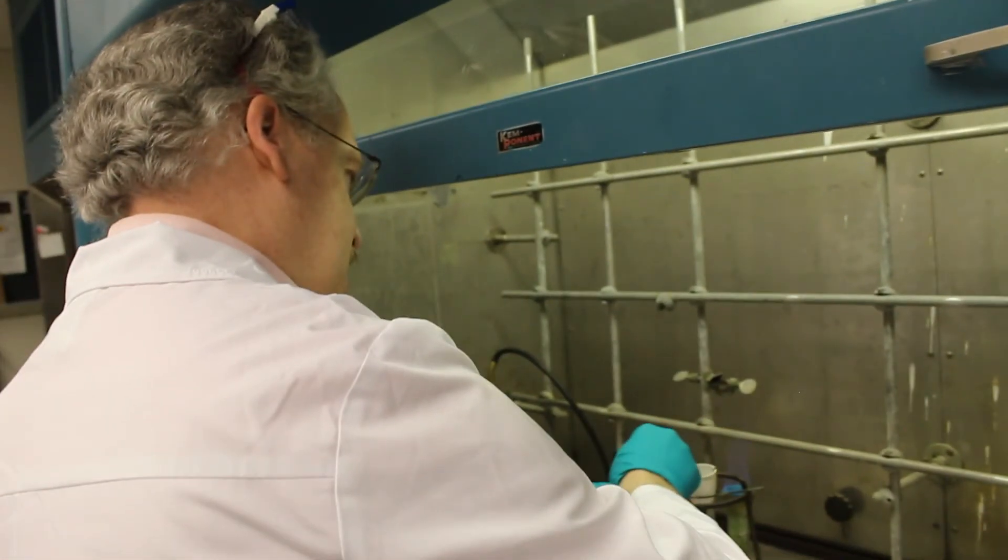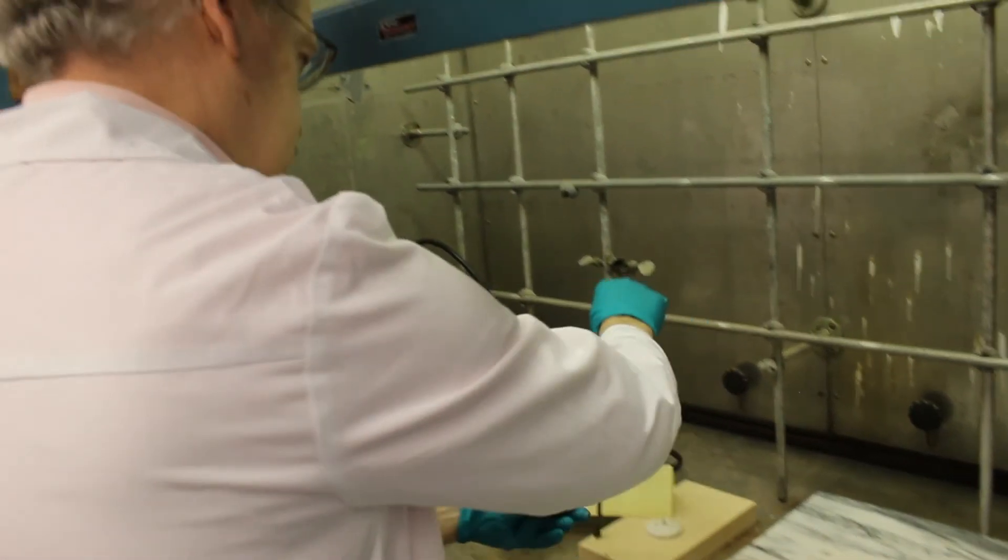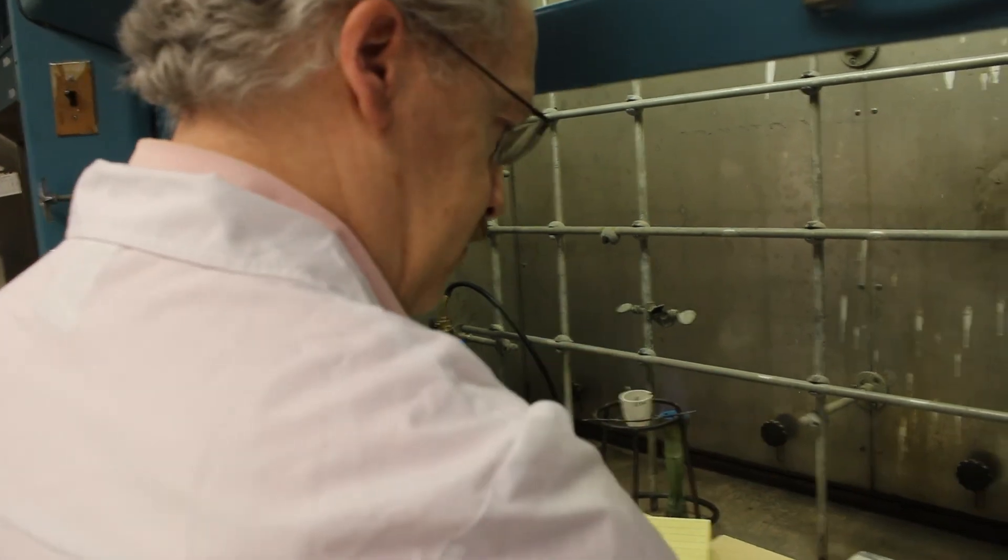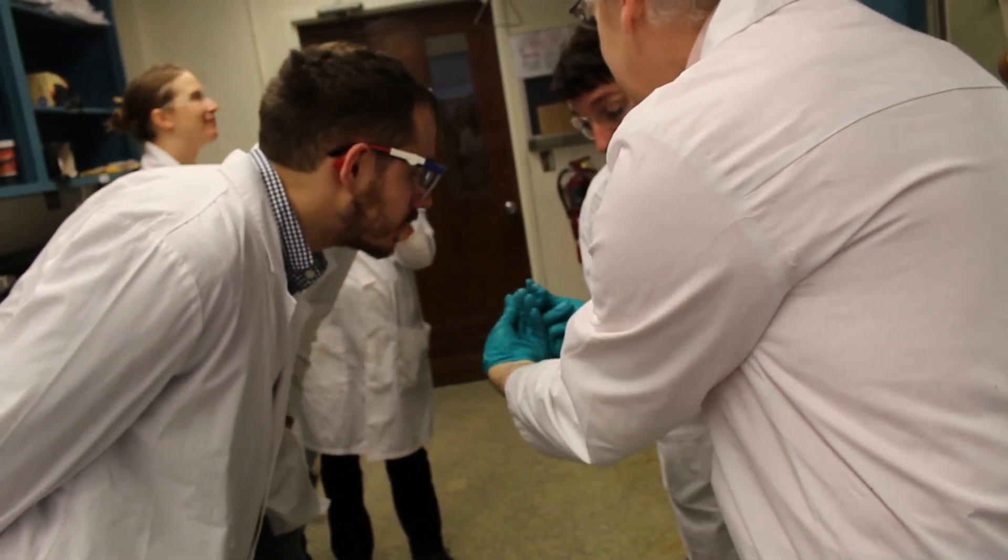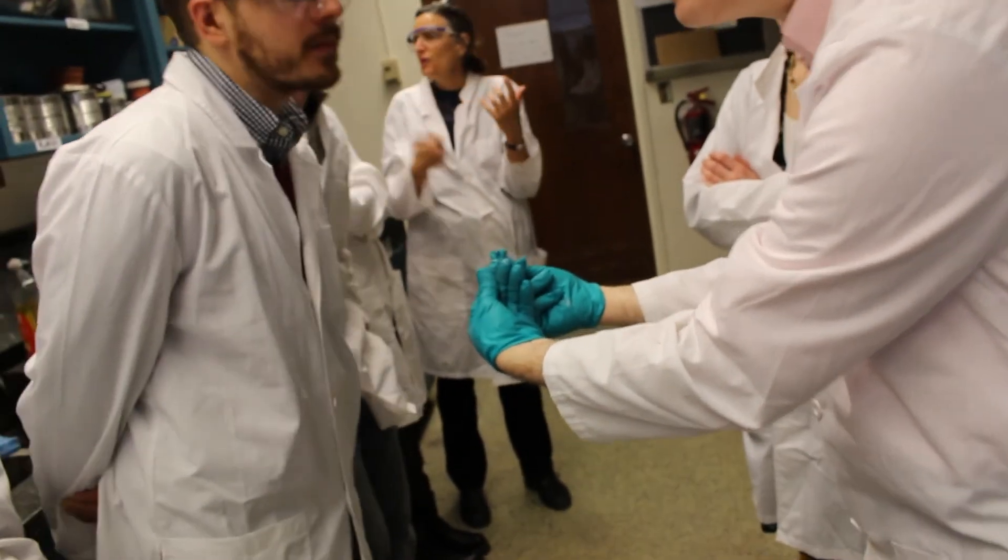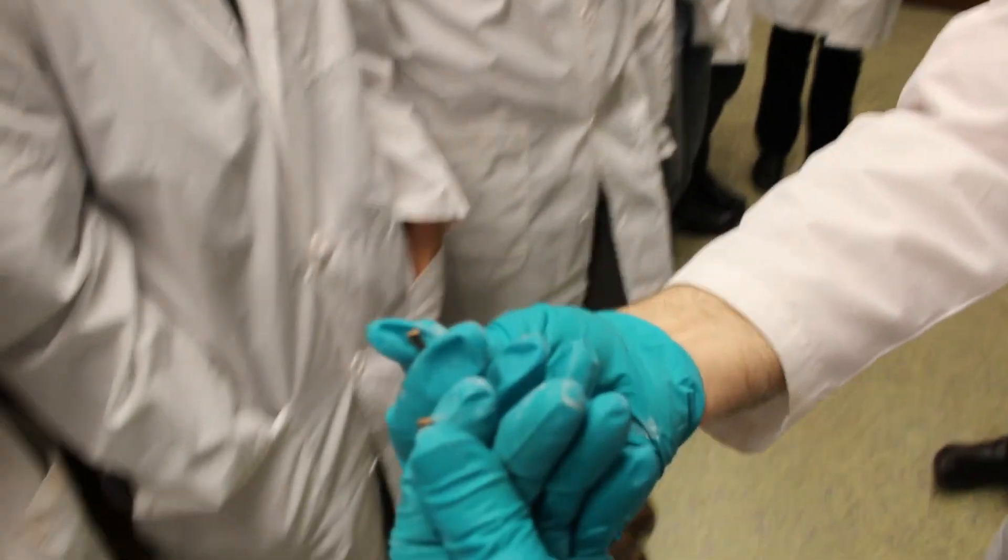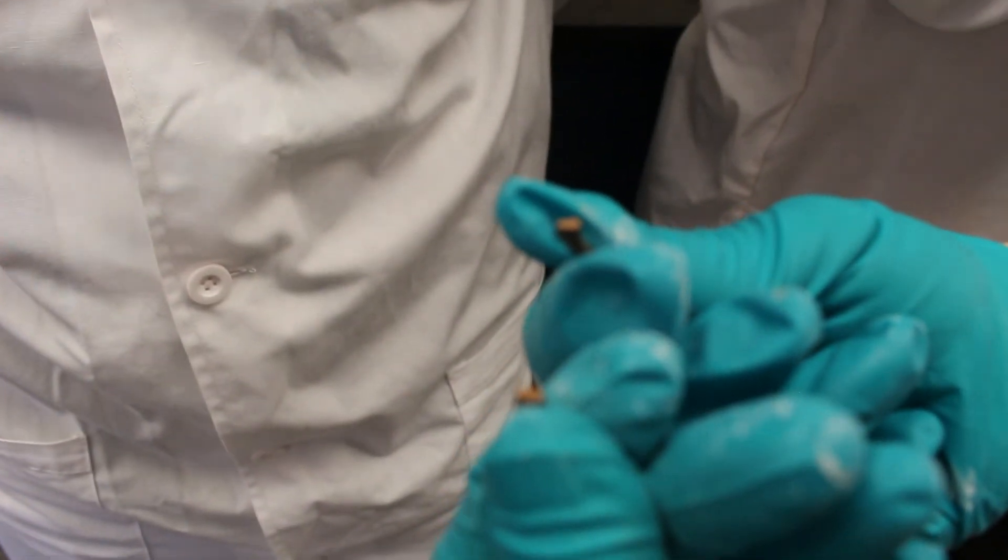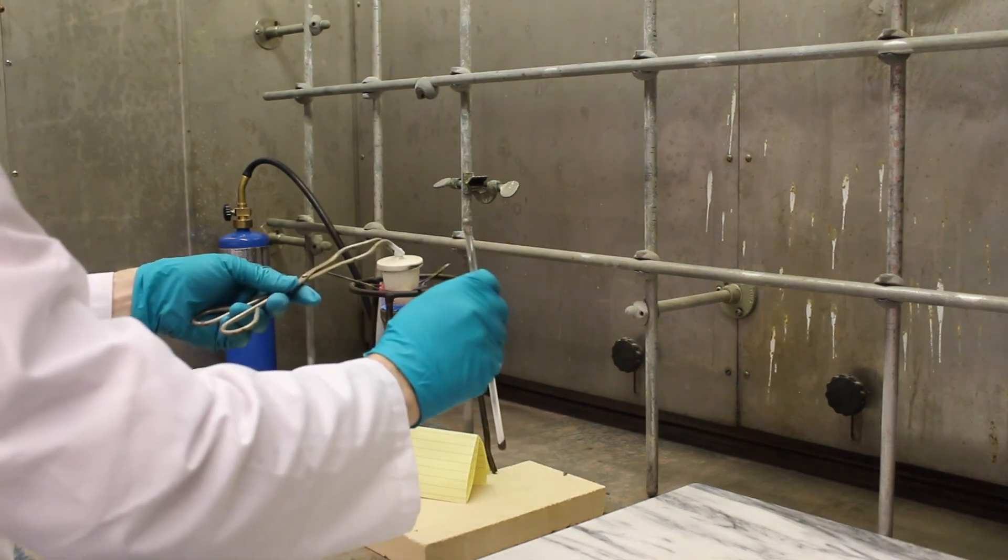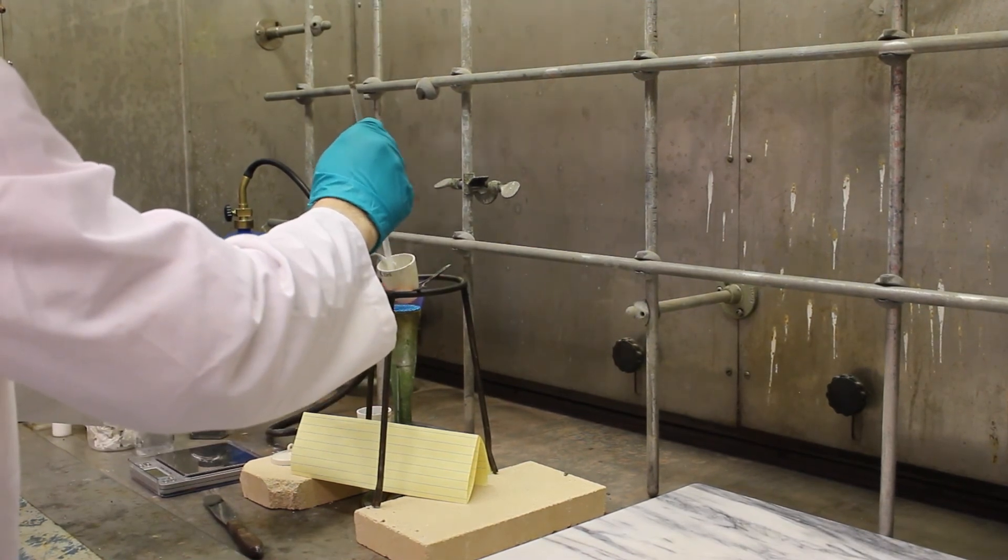What I'm doing here is I'm going to put this back in the crucible. Oh, you can see, especially if, let me see if I can find a bit to break, right, look at the broken face. It's sort of copper colored, but it's completely crystalline. There's no, even the other one, when it didn't work so well the first time, at least had a vitreous shine to it. This, there's no glassiness at all. You can see. It's almost metallic. Yeah. There's no glassiness at all.